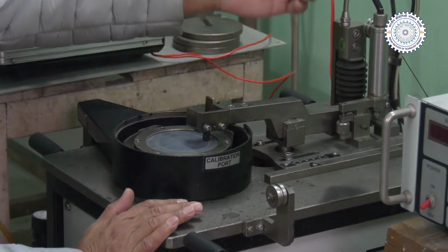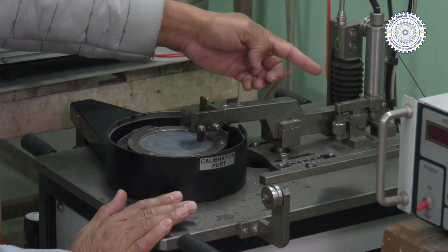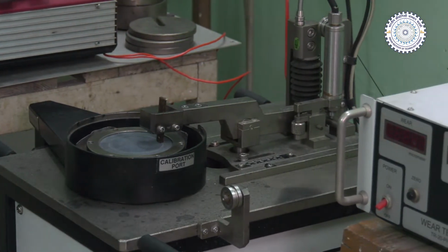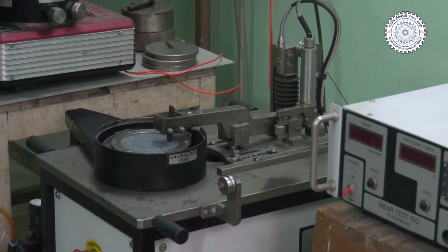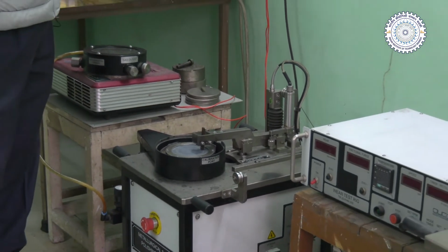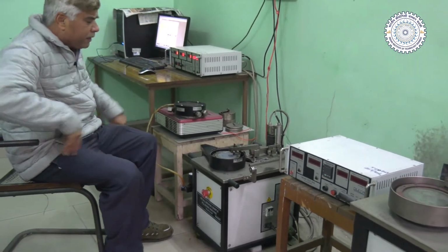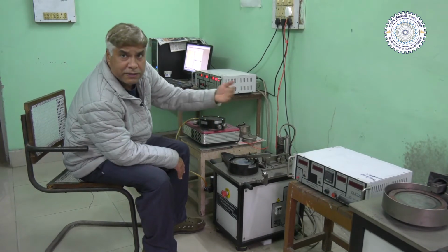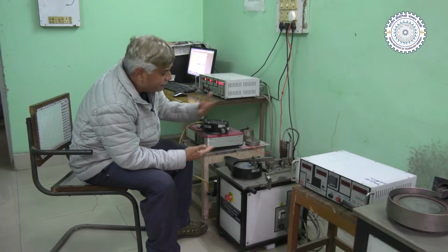Here there is a chain pulley arrangement or wire pulley arrangement, so the dead weight is applied from the back side. Whatever load is applied, say 1 kg, then 1 kg normal load will be acting onto the sample. If you want to conduct the adhesive wear test at a higher load, then accordingly we change the magnitude of the dead weight that is being applied.